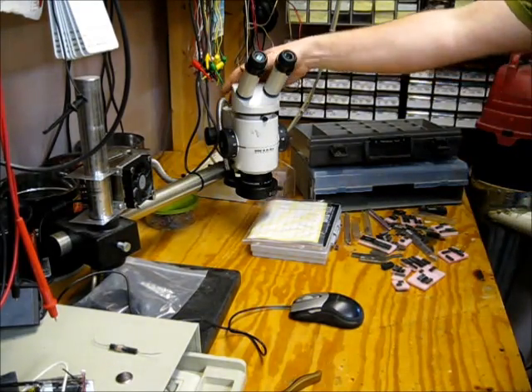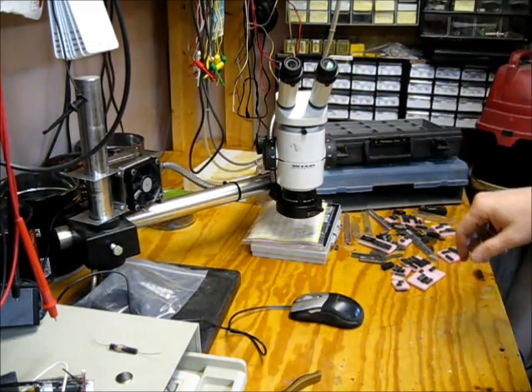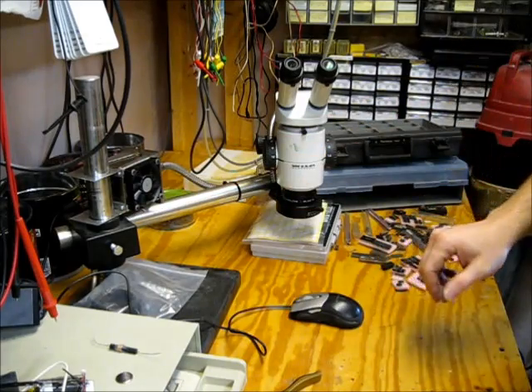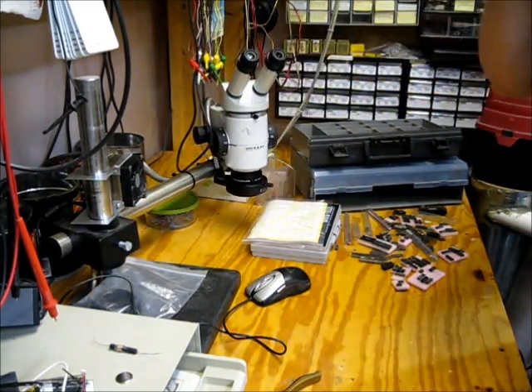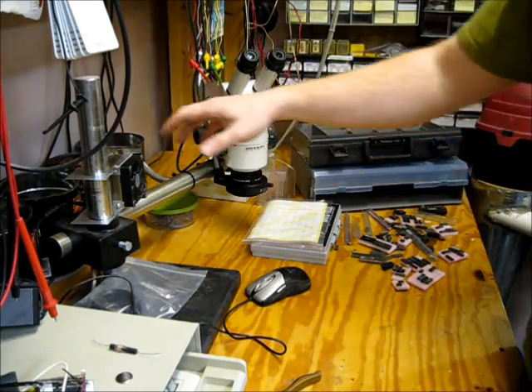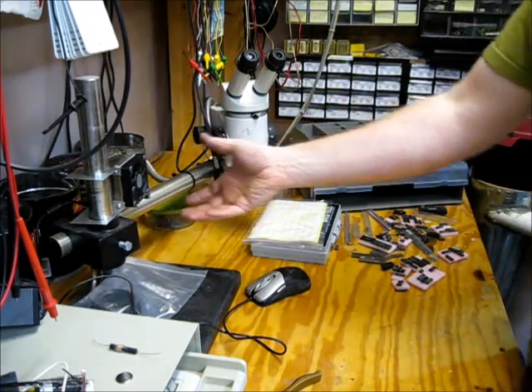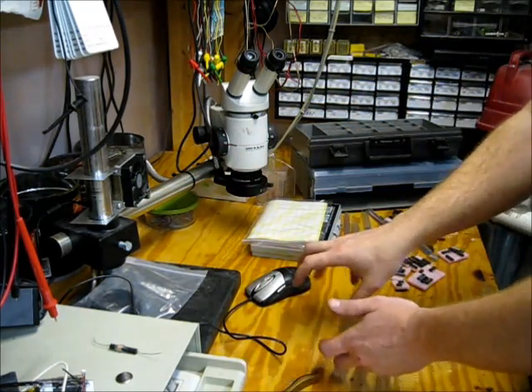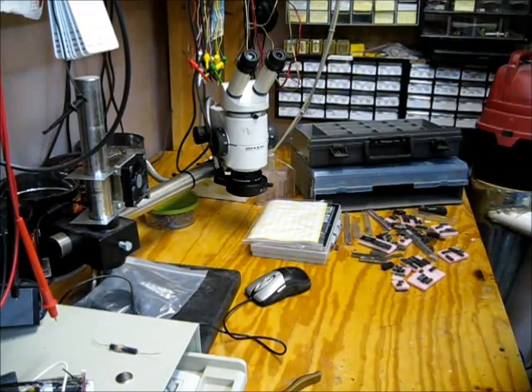Hey all again. This is sort of the third and hopefully final update on my 10-watt LED fiberscope light. So here's my microscope on its stand. After much consideration of how to mount the light and heat sink, I was considering little boxes so it could sit on my bench, and trying to figure out how to get air through it and not have stuff dump into the fan.